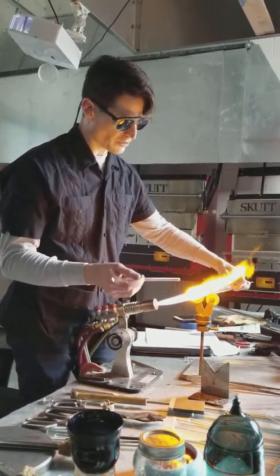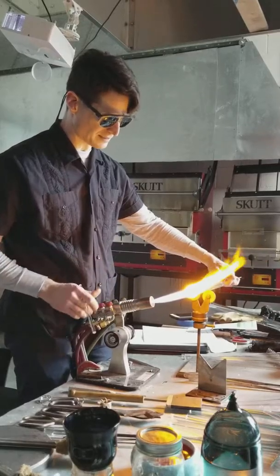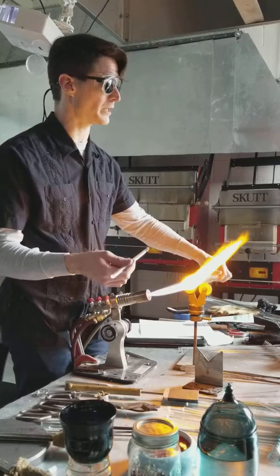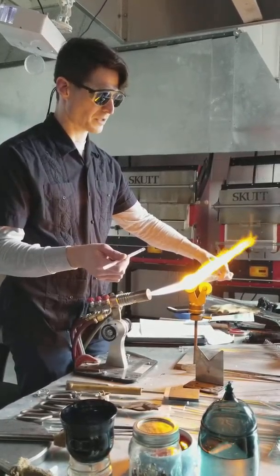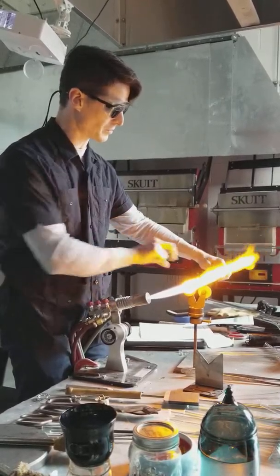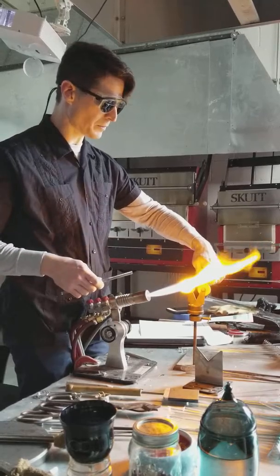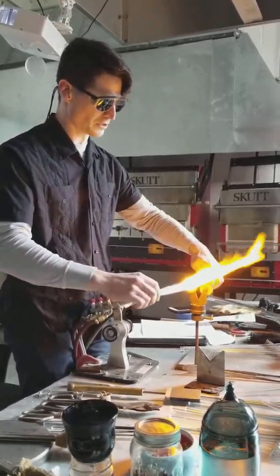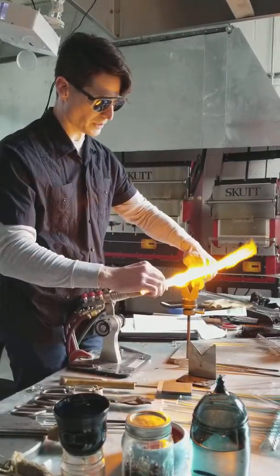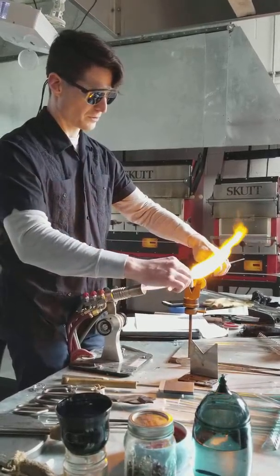Then I'm going to punty. Notice I'm building my heat up first before I punty, because if I have my heat set it's basically ready to pull — the heat is ready, it's a liquid. I touch it, I get something I can pull with, and then I take a second to even my heat out. Then I come out and make my pull. I'm choking up on my tube so I have a little bit easier control right here. Make sure you don't grab where you just pulled the point — that'll wake you up. So I touch, and then I back.